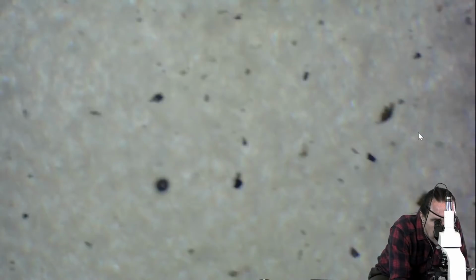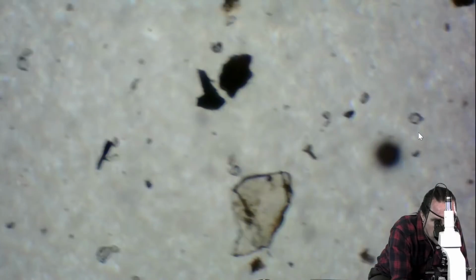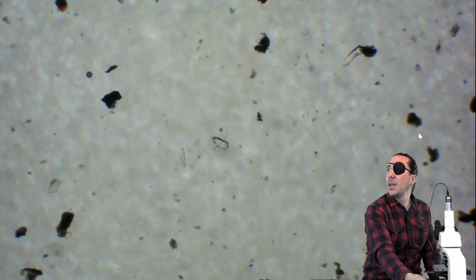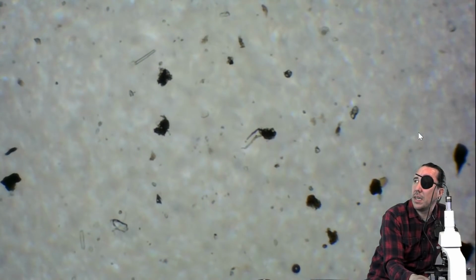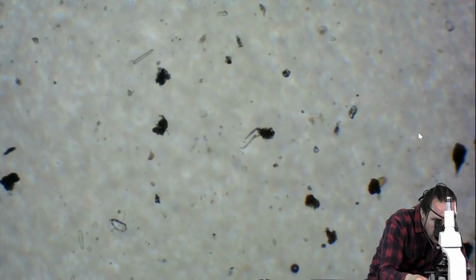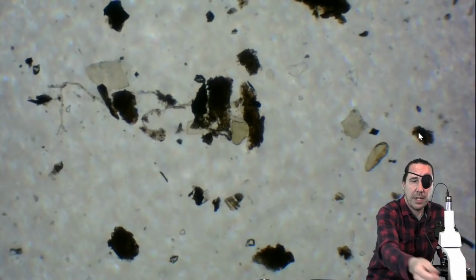What is this a sample of? This is the other compost, the newer stuff, I believe. You're looking at compost right now? Yeah, Dan had handed me a different sample. I'm just going through it real quick to see if there's anything interesting. It's a different compost that they have here on the farm. There's not quite as much aggregates and organic matter.